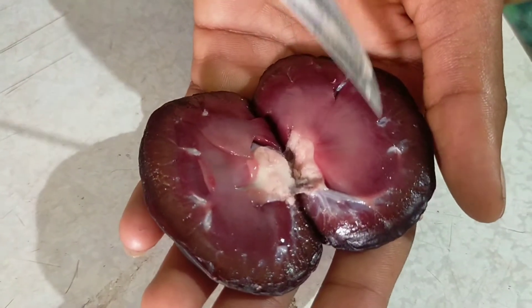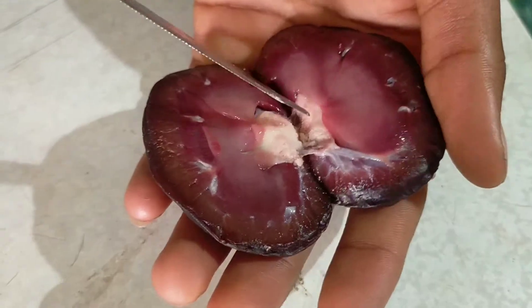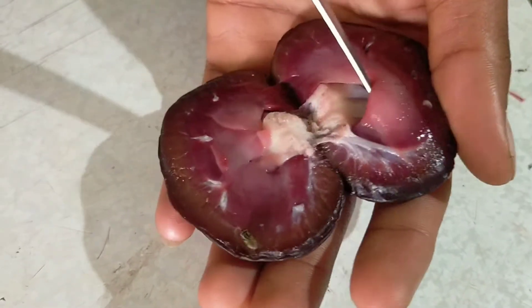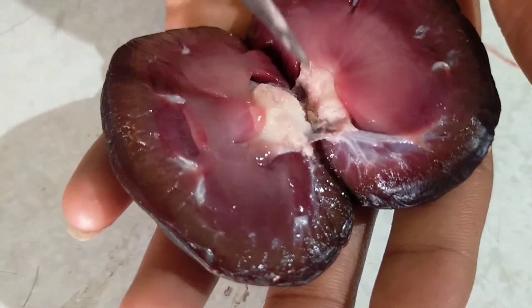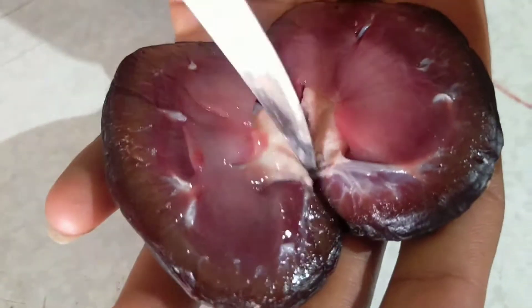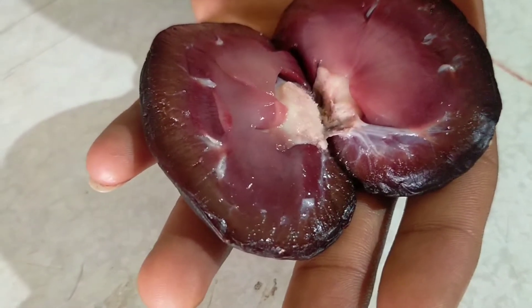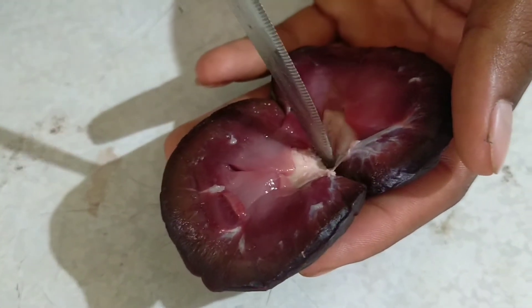And this hole like structure, these are known as medulla. And here we have the renal artery. Renal artery and renal vein which supplies the blood in the kidney. And here this small hole like structure, that is — sorry — ureter. So here I have ureter and renal artery and renal vein.